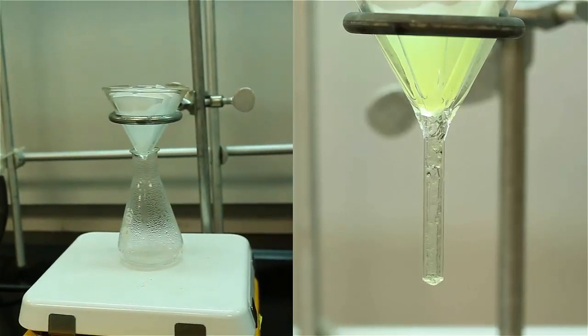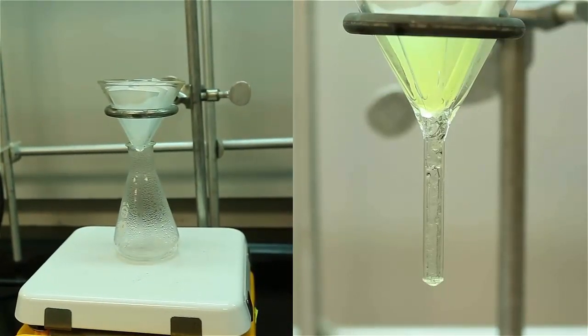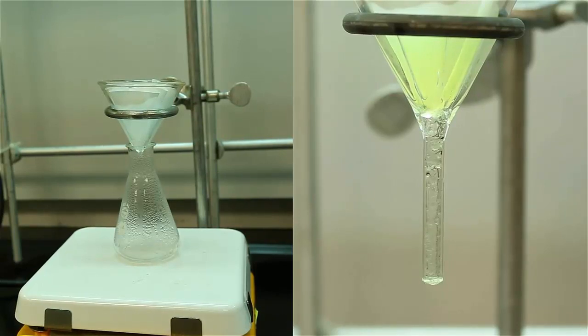Some crystals will inevitably form on the filter paper since the solvent evaporates. Simply add a little bit more hot, pure solvent to re-dissolve the solid.